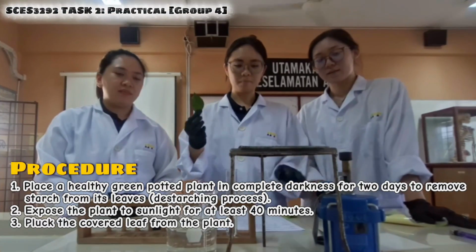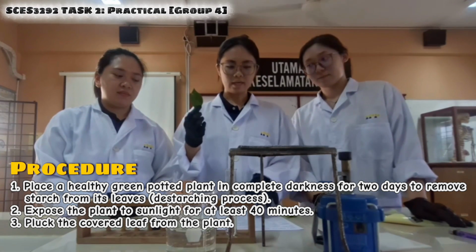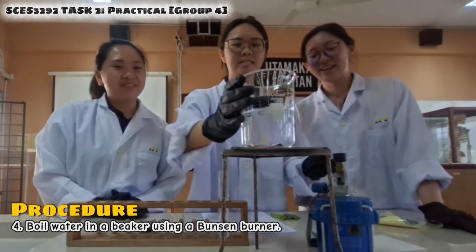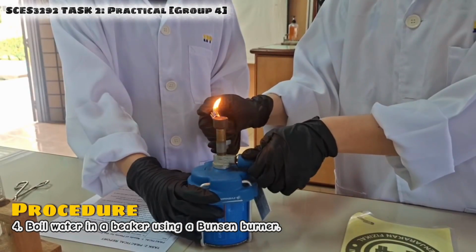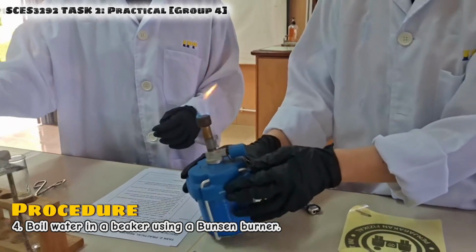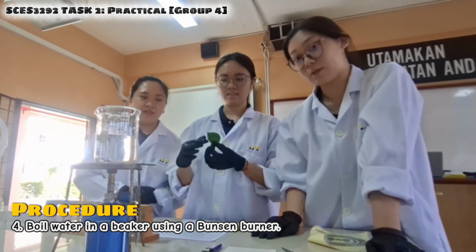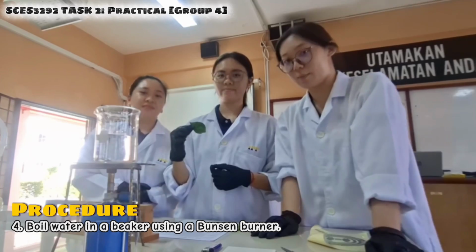This is the leaf we have placed in complete darkness for 2 days and already exposed to sunlight for at least 40 minutes. Boil the water in the beaker using a Bunsen burner. After the water is boiled, we put the leaves into the boiling water for 5 to 10 minutes to break down the cell membranes.